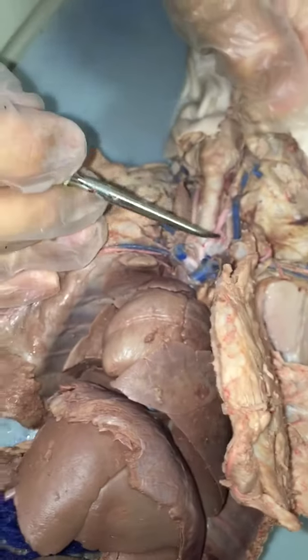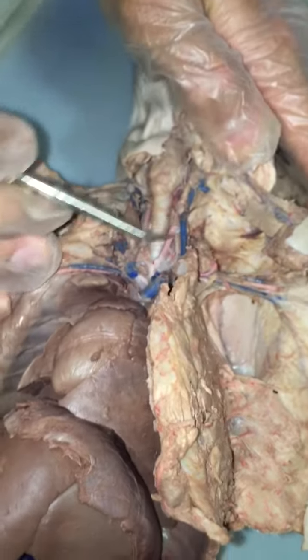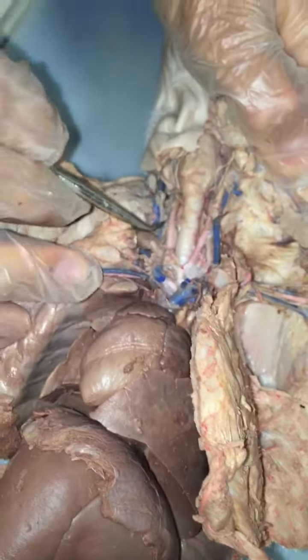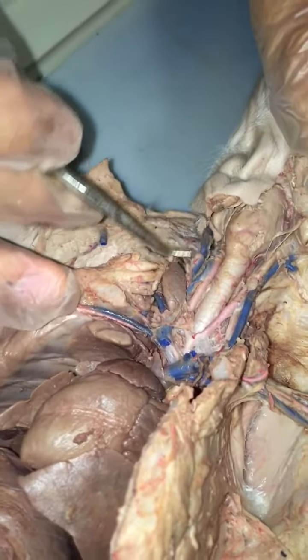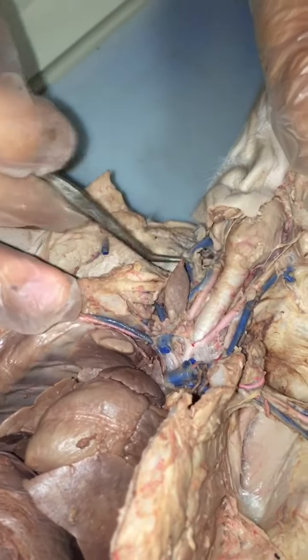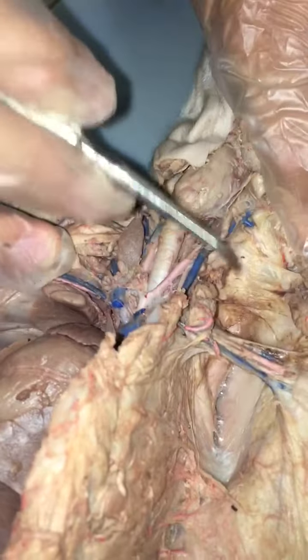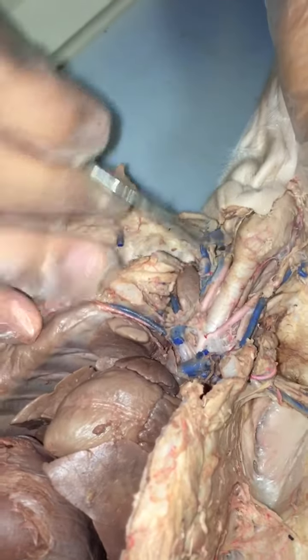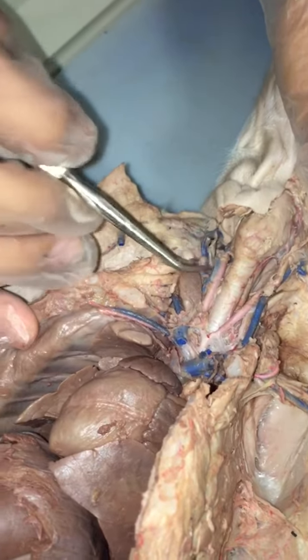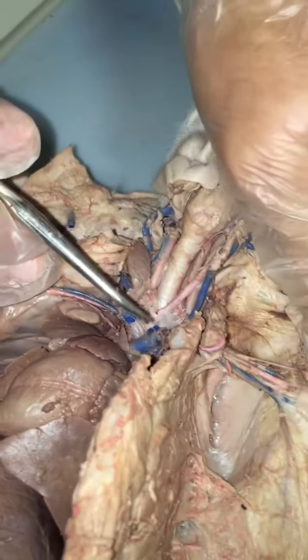Left common carotid artery. We already went over this. And the right internal jugular vein. So internal jugular vein right here, right next to the carotid artery, and then external jugular vein, which both go up to the neck. The jugulars both go up to the neck, both on the right side. They're on both sides, but here it's not exposed, so we would have to say internal jugular vein or external jugular vein. Yeah, just internal and external. You don't have to say right or left. I'm not sure, but on last week's quiz, he said the right and left didn't matter.